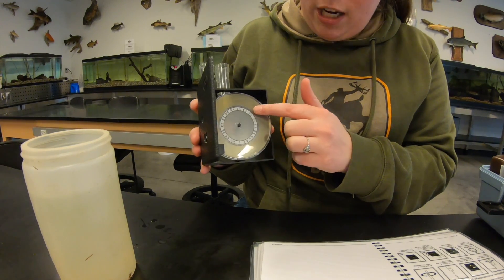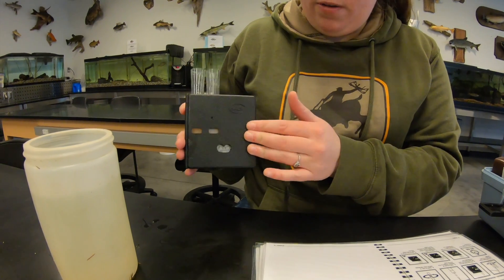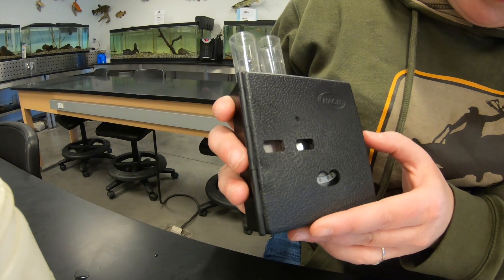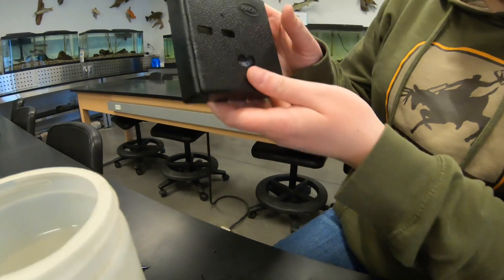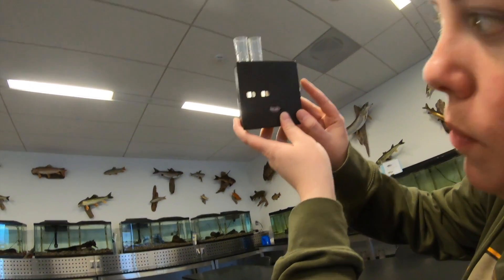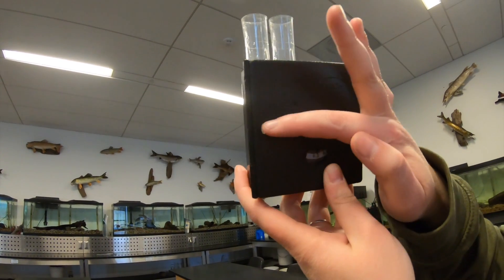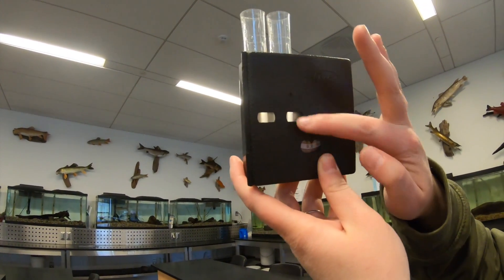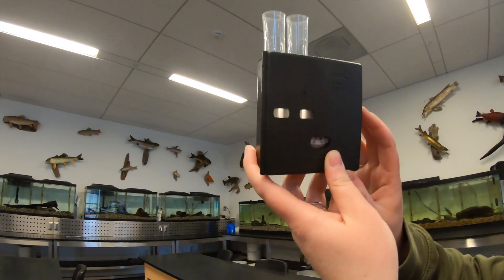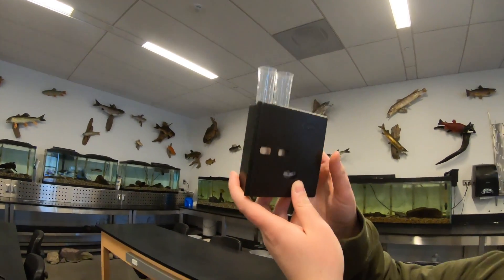It's been about a minute. We have the viewing box with the color wheel. You look through either window to see if the solution with the Nessler reagent changed color, which tells you the ammonia level. You spin the color wheel and hold it up to a light source to match the color. Honestly, to me this just looks like a zero reading - it appears there's no ammonia in this water, which is good.